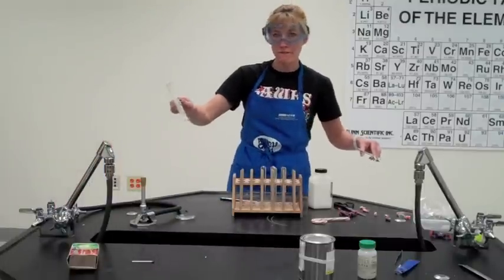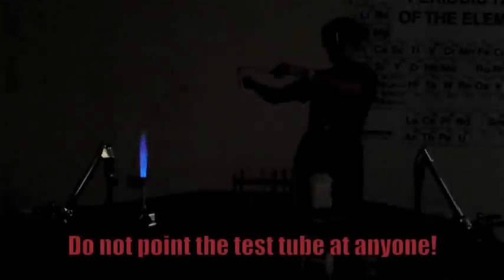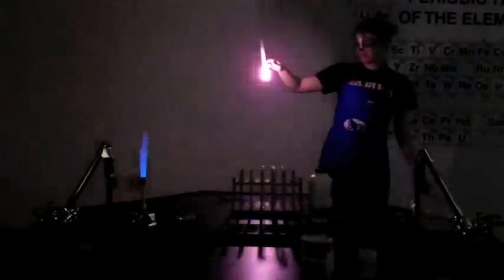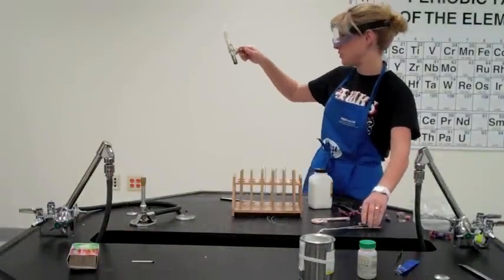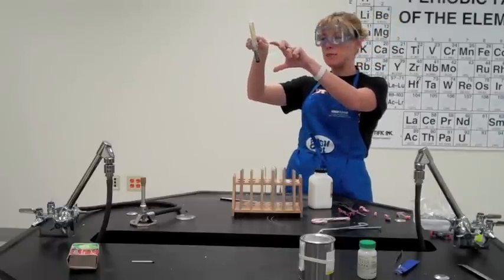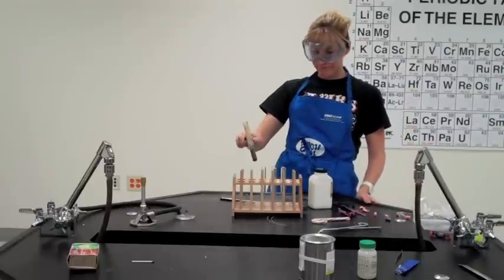Our test tube is filled with oxygen — here we go with the candy. What happens is you have the heated oxygen and you introduce the sugar, and you basically have a spontaneous combustion with the sugar and oxygen to produce carbon dioxide and water vapor. All the black gunk in the bottom is basically the other ingredients in the candy having been burnt to heck and back.